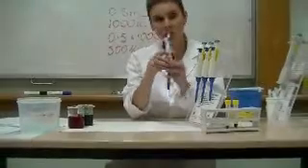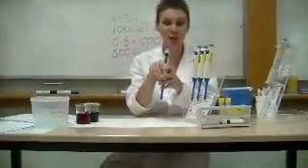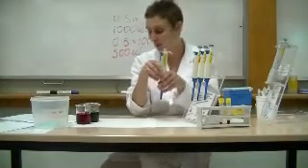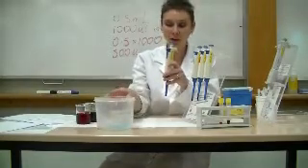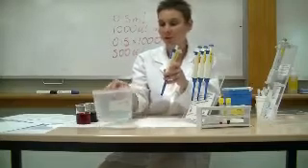do always hold the pipette upright. Do attach a tip before you put your pipette into the solution and make sure that it's the correct tip and that it is attached firmly. Do eject the tip into the waste bucket, and you can do that using the ejector and therefore without touching the tip.